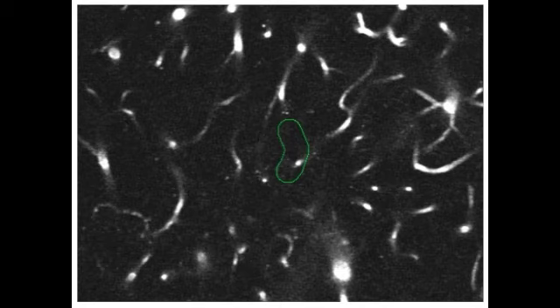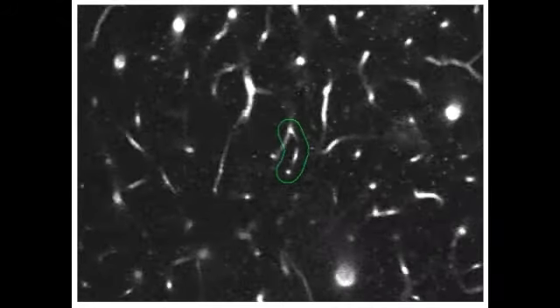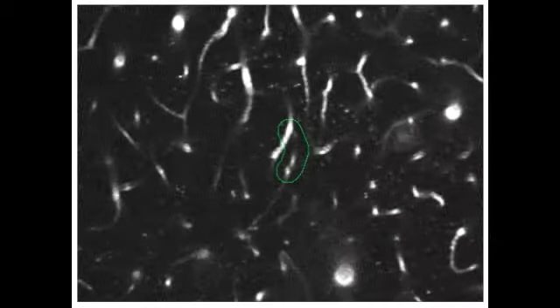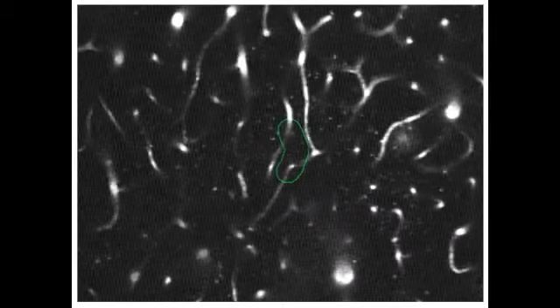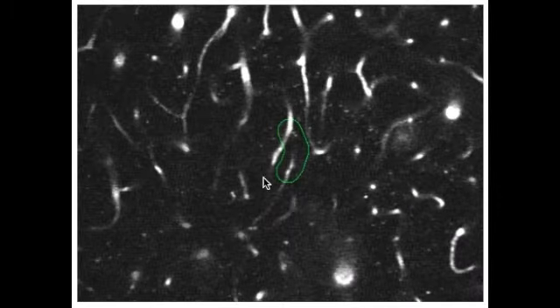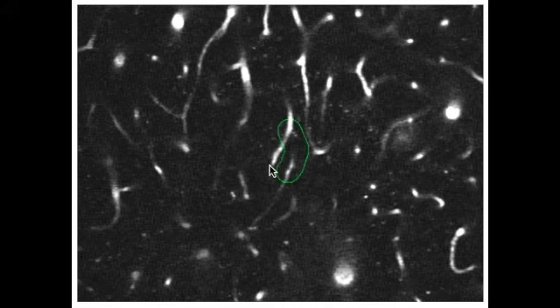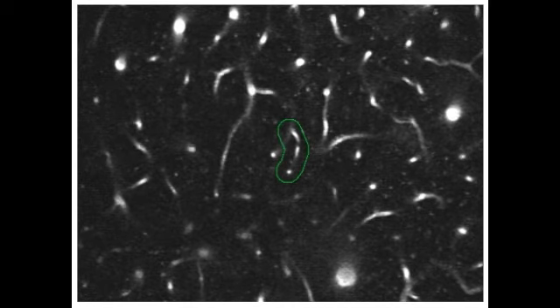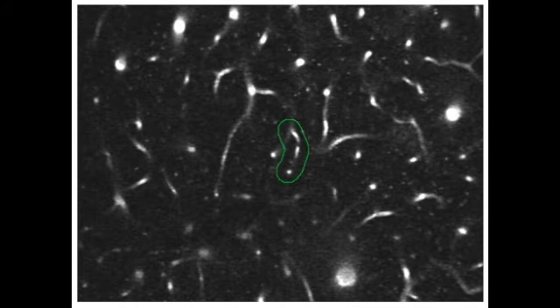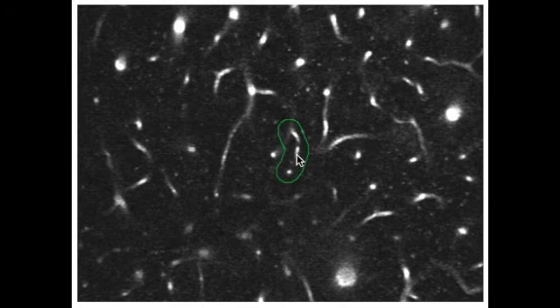This looks like another one of those nice high-contrast movies, which are a lot easier to interpret than some of the grainier ones. The question is, where is the vessel that we're targeting here? Which one are we supposed to be looking at? Here's one vessel, but it kind of crosses through the green outline, so that's not the one we're interested in. If we move the slider some more, we see what appears to be a continuous vessel that follows the shape of the outline.